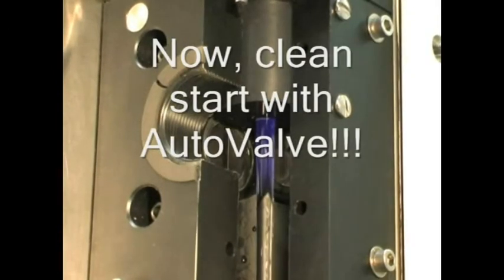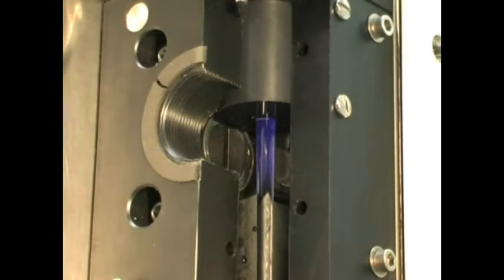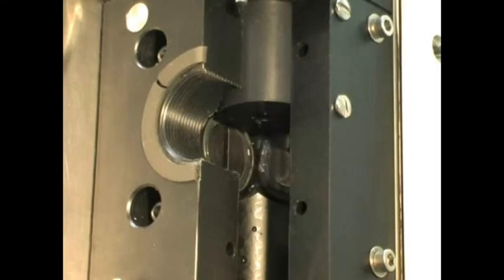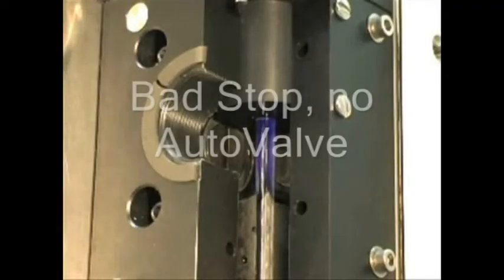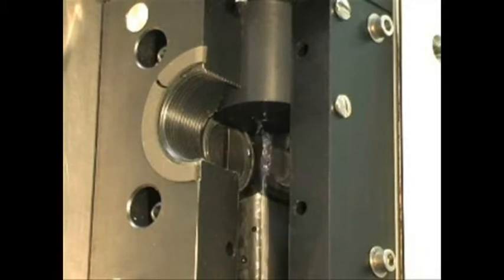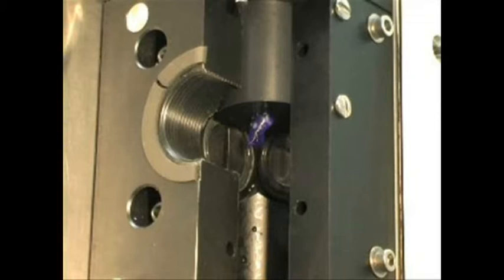Now let's watch a nice clean start using the auto valve and watch for the unorganized stop as the water drains without the benefit of the auto valve. Here it is again, frame by frame. This is what happens inside a falling stream flow cell without the benefit of a bubble trap or auto valve.